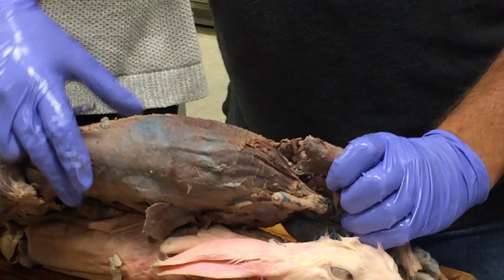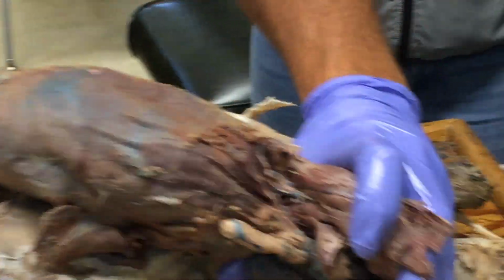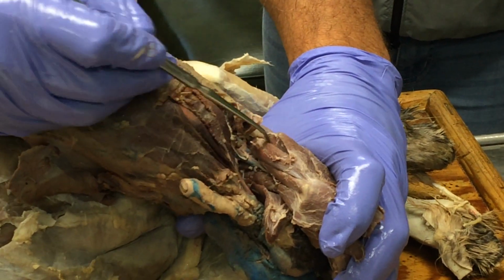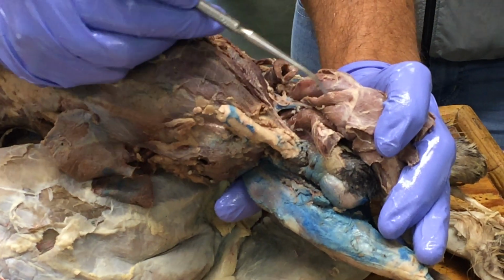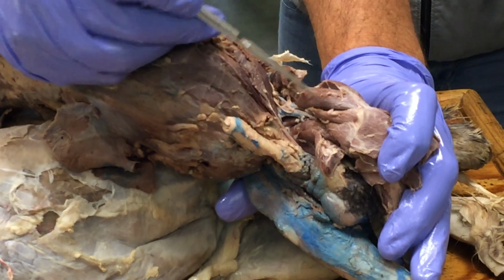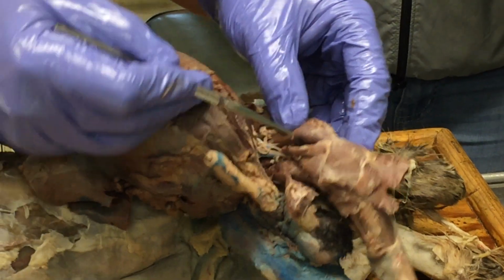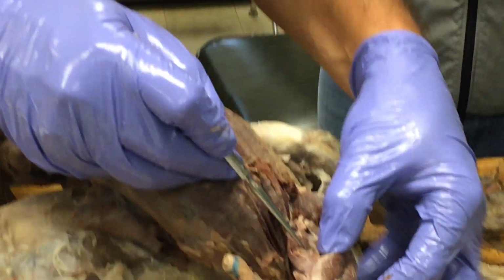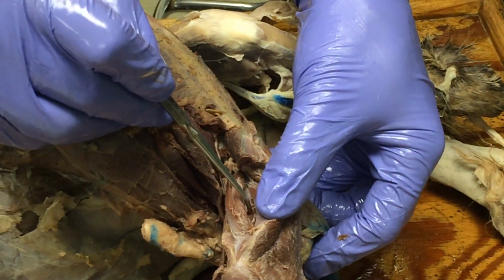They're very cute. There's these cute little stubby legs, but there's this one on the lateral side, so that would be vastus lateralis, and then here on the medial side, vastus medialis, and then this thing in between, that's the rectus femoris. Yep. And then the vastus intermedius, you have to look kind of way down in there, but this thing deep in there is the intermedius.